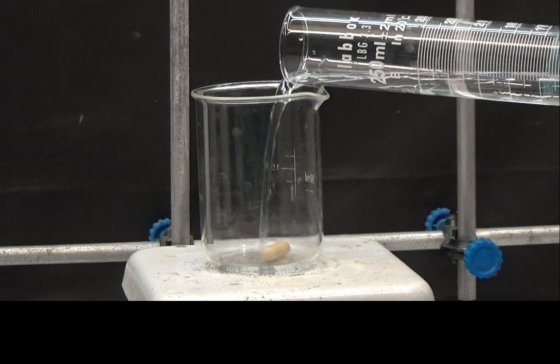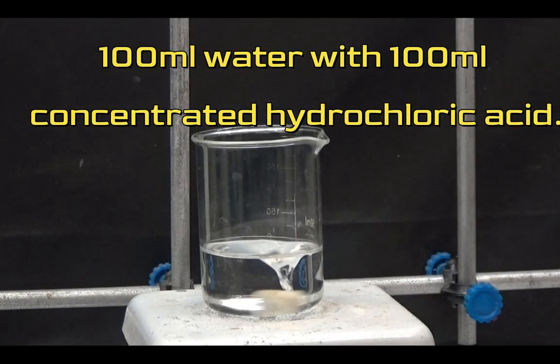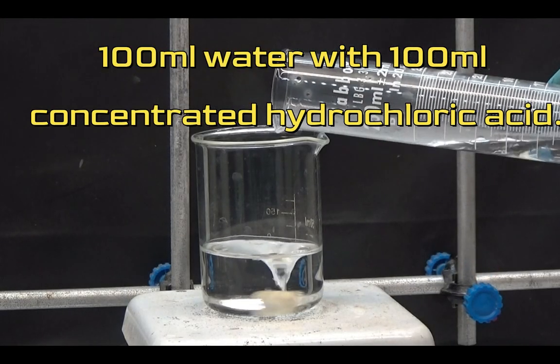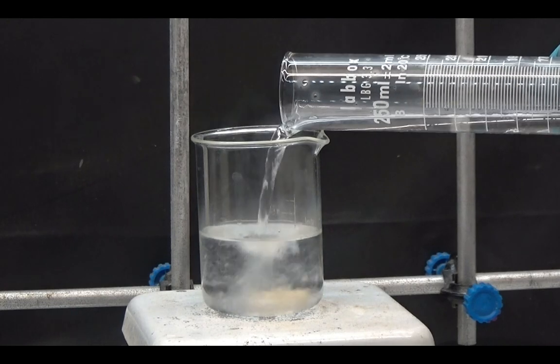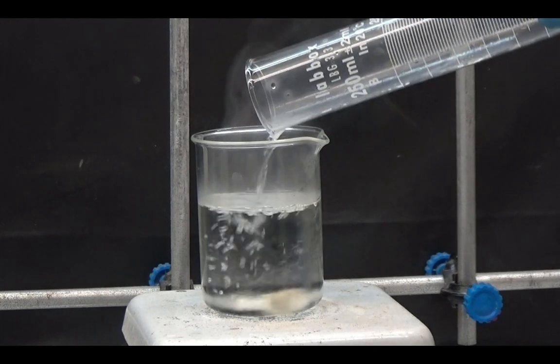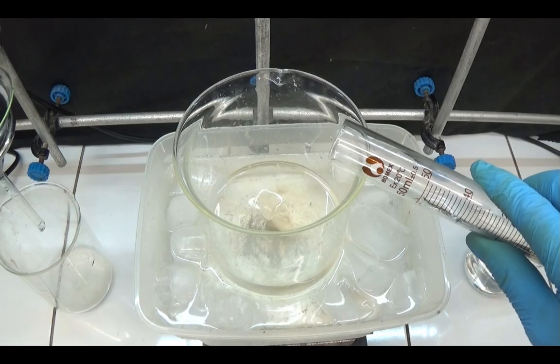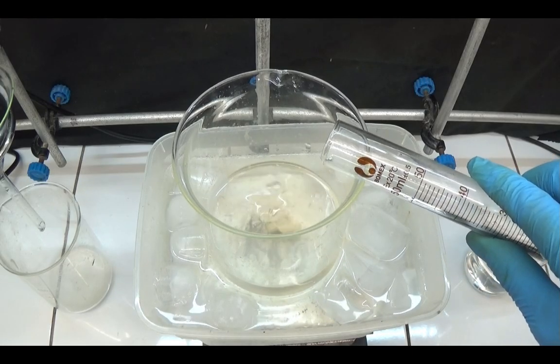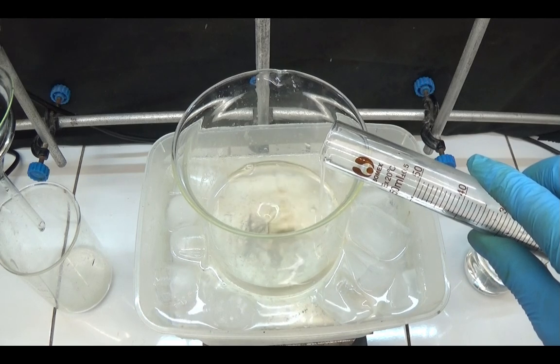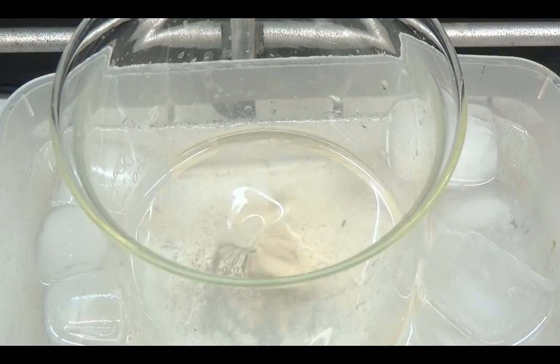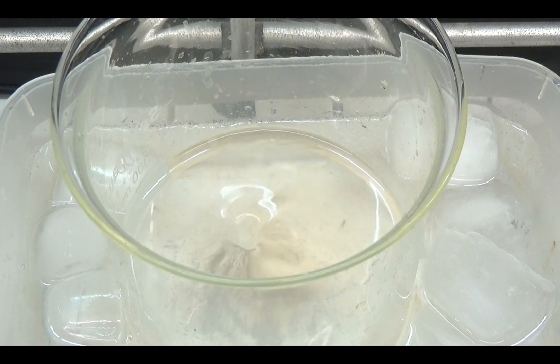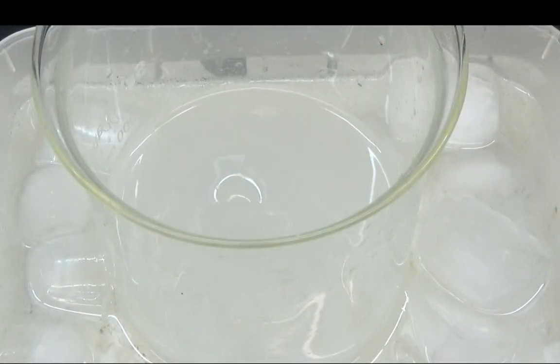Prepare diluted hydrochloric acid by mixing 100ml of water with 100ml of concentrated hydrochloric acid. Cool this solution in a cold bath of ice and water. The diluted acid is added in small portions of 20ml. The mucic acid precipitates into a white solid when we add the first portions of diluted acid.